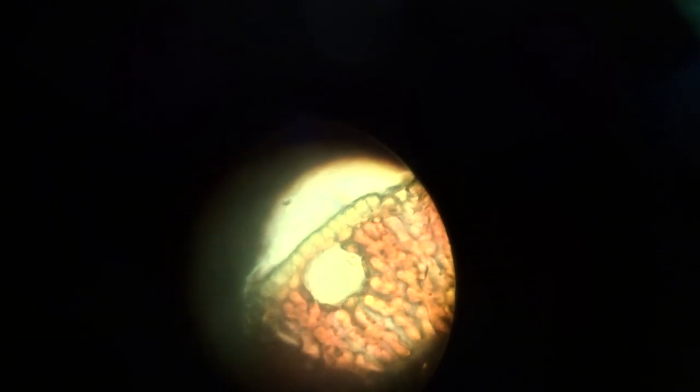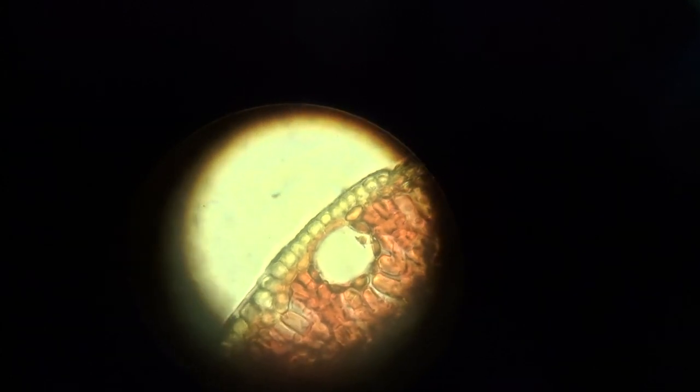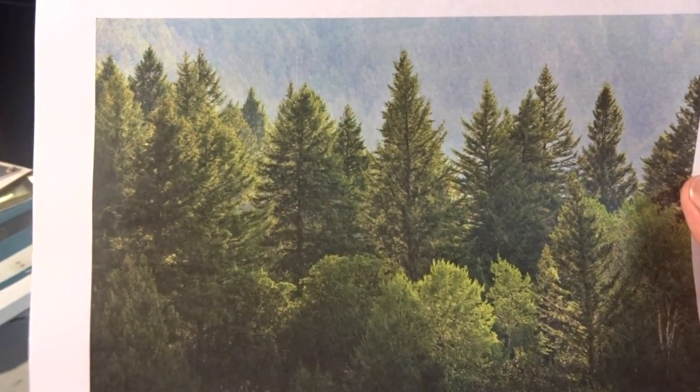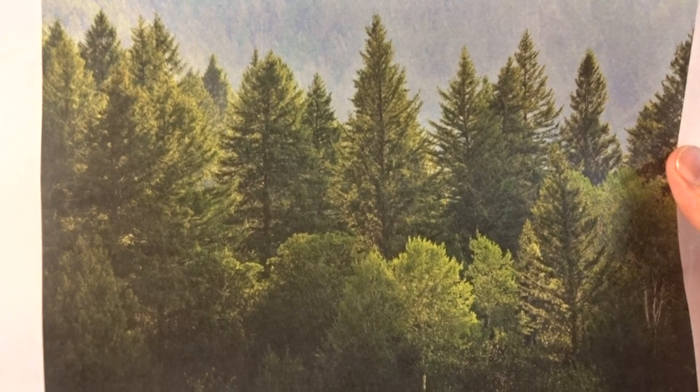So as you can see, the pine needle consists of cells. This is under high power, and still under high power the cells are small and difficult to see. It's amazing the detail that you can see, and just think that a pine forest consists of trillions and trillions of cells — that is profound and beyond belief. That's God's creation.